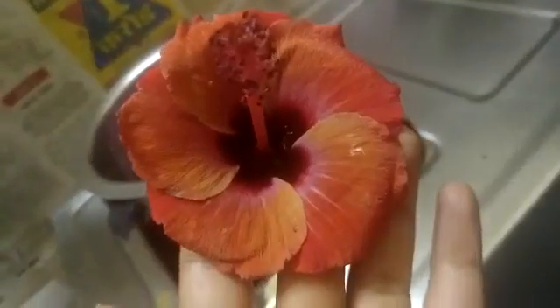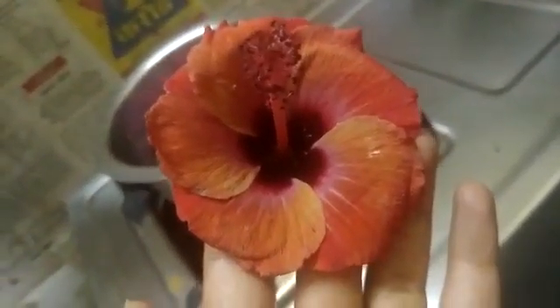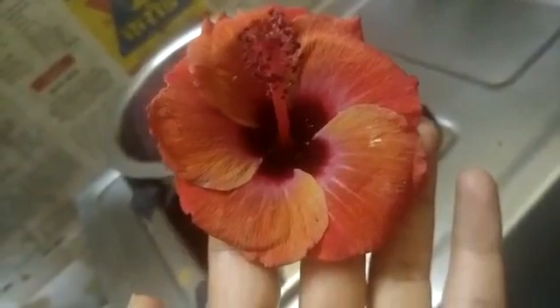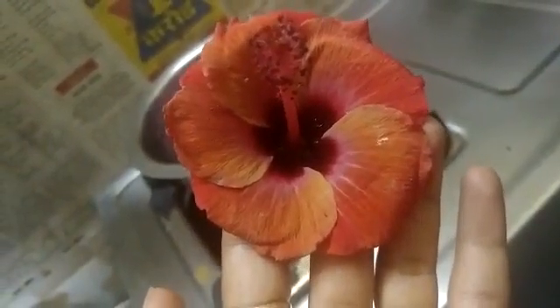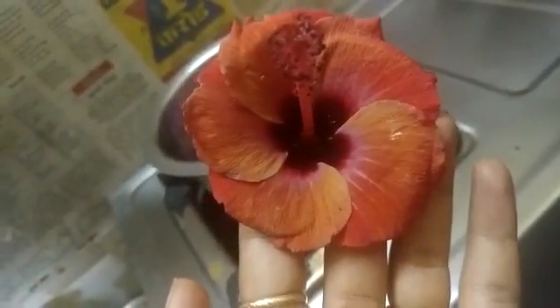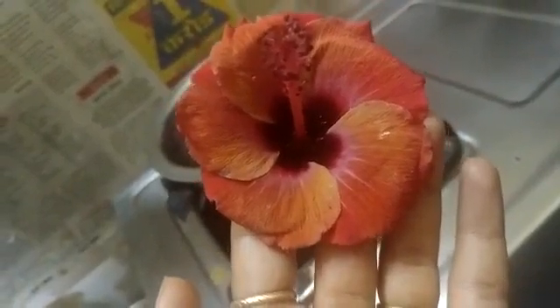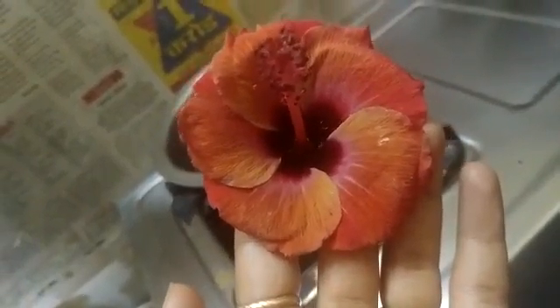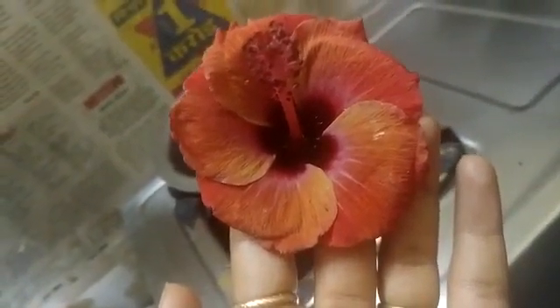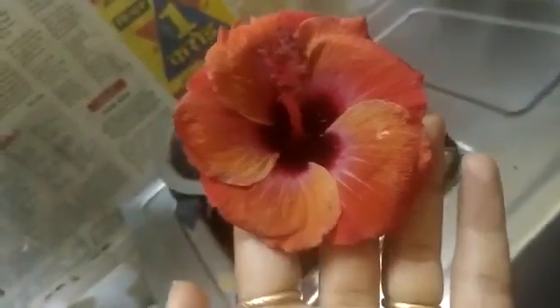Hello students, today we are going to do the activity based on the China rose flower, also called hibiscus. We are going to do an acid-base test by using China rose.